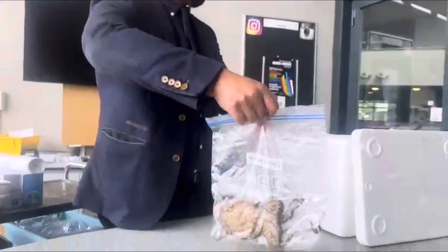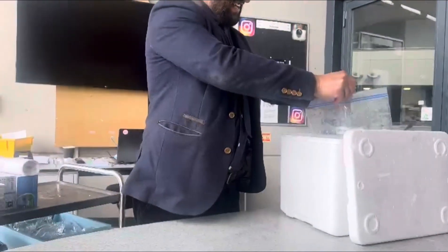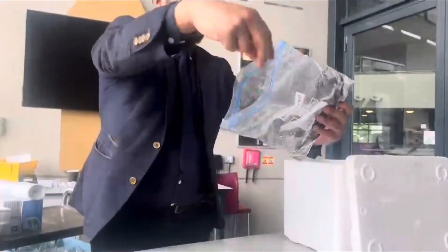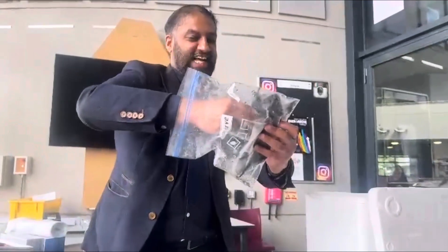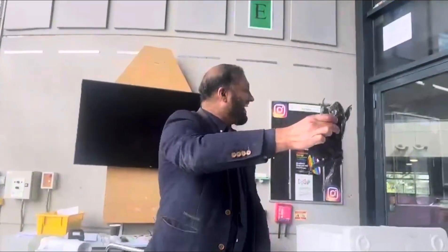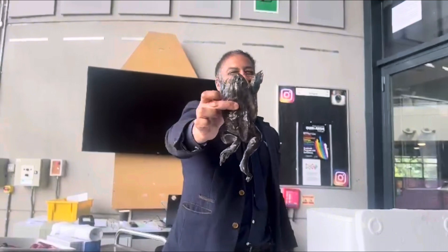I'm going to open it. [Student:] Why have you been over here so much? [Teacher:] What the hell? It's a frog. Alright, what's up? I need your gloves on. [Students exclaim and react.] Sir! Look at that! Sir, why are you holding their hand? Hey, catch!